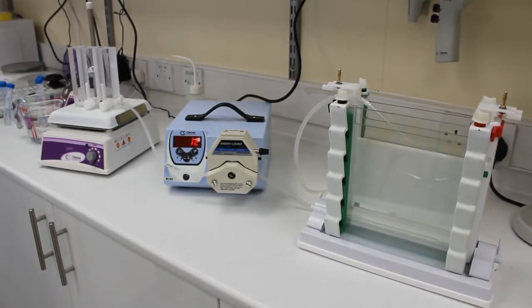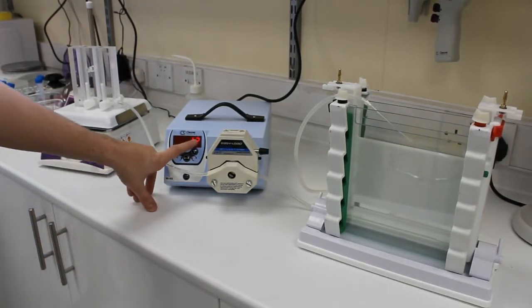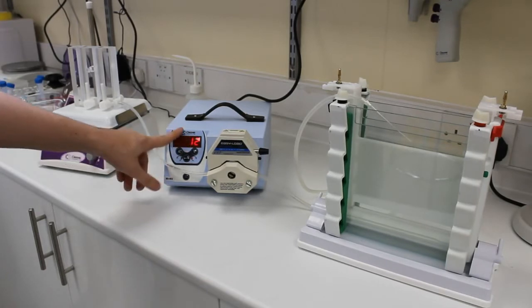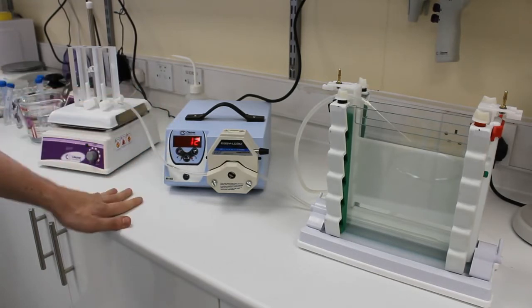So we've already made all of our solutions that are outlined in the manual. We've got our MUD02 pump set to 12 rpm which equates to 10 milliliters per minute. This will be different on the different models of pump, but you can easily test it and they're also written with the different types of tubing in the manual what the flow rates will be.